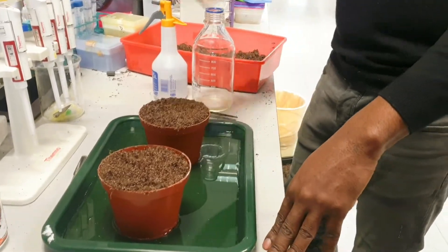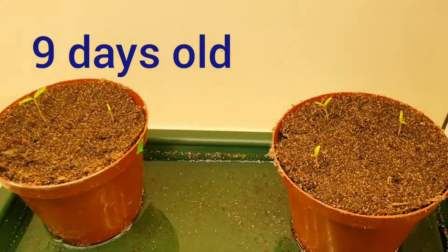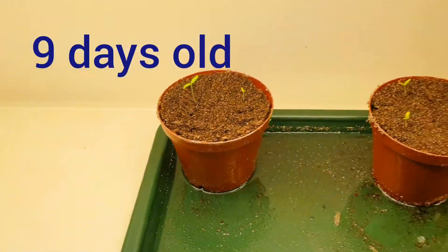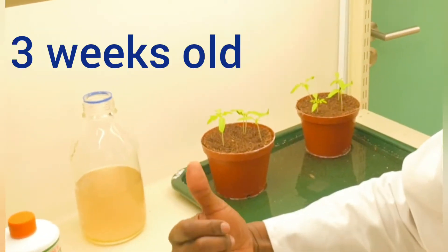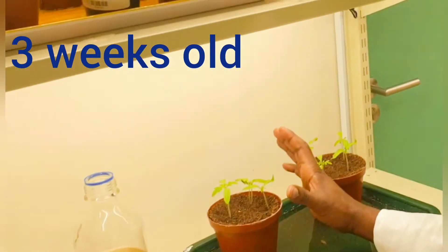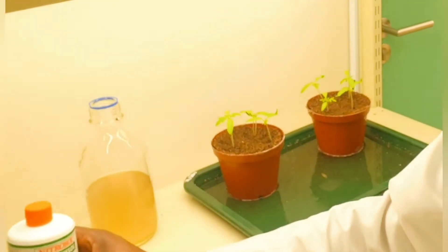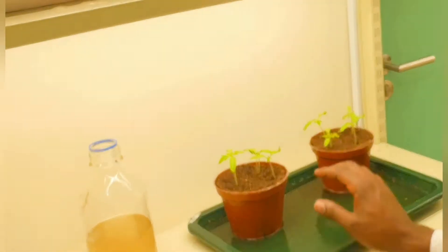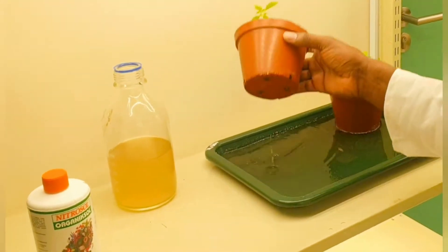I will take you through as the seeds germinate until when we use them for our experiments. This is a few days old tomato seedling. It is three weeks old now. As you can see there is no infection. I have already watered it with nitrosol and water, mixed together, once every week — usually on Mondays or Tuesdays. You can see it's taking up the water from the bottom of the cup.